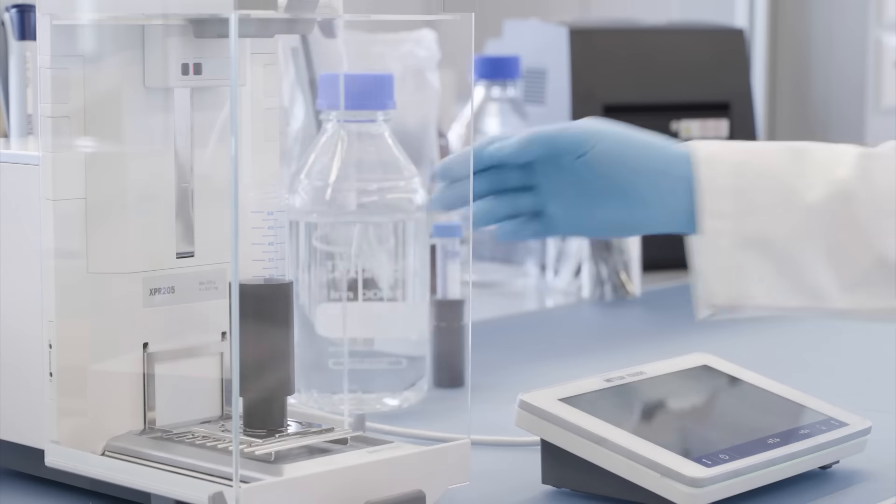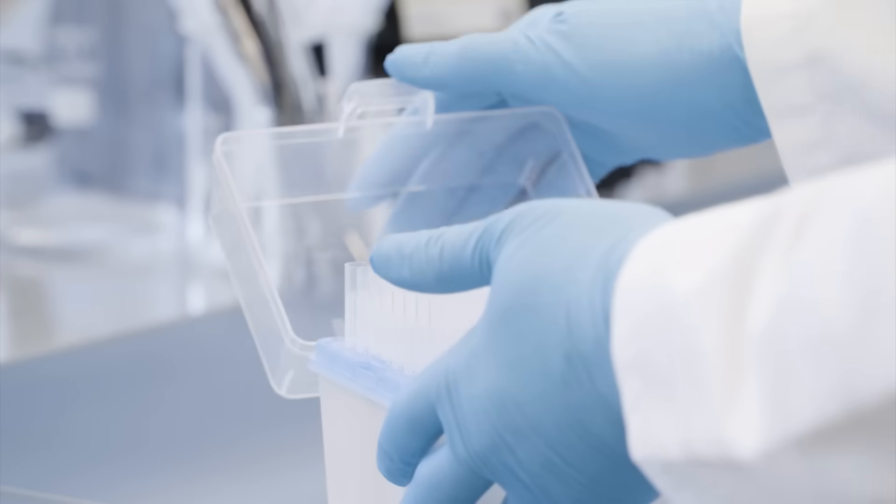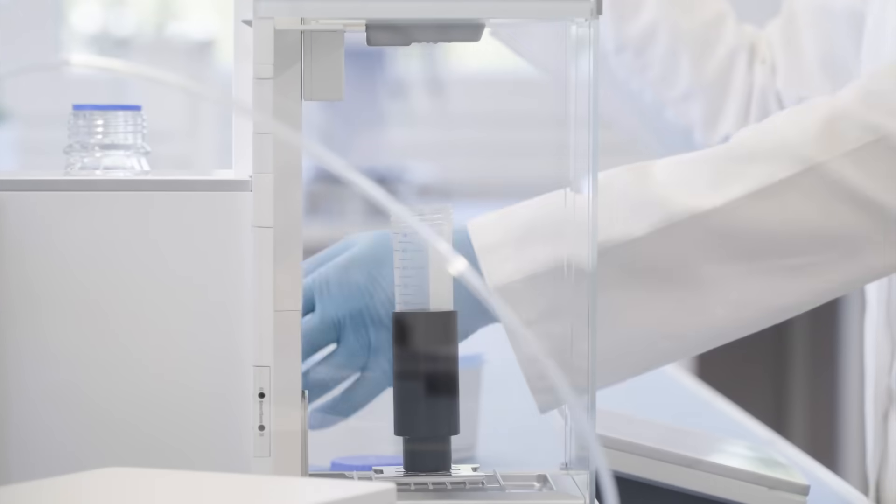Place the container in the weighing chamber and pipette an aliquot of your concentrate.